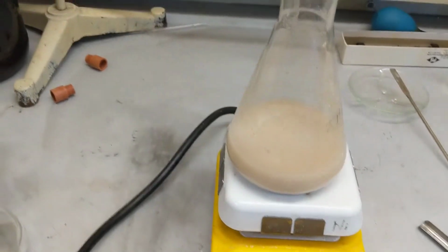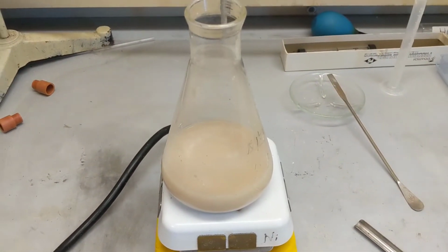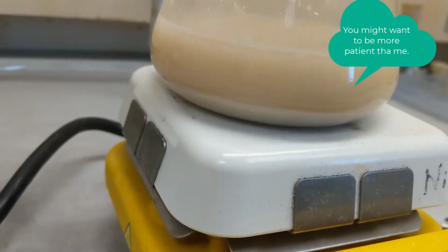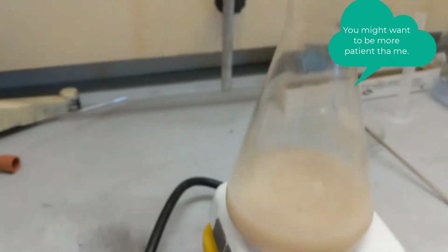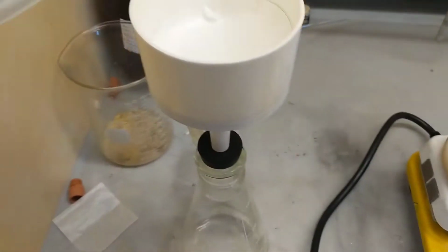I'm just going to let this settle back down, try to get it not so cloudy. See you guys in a second. Alright, so I've waited about 10 minutes. As you can see, the solid has settled to the bottom. So I'm about to use my Buchner funnel to filter everything out.